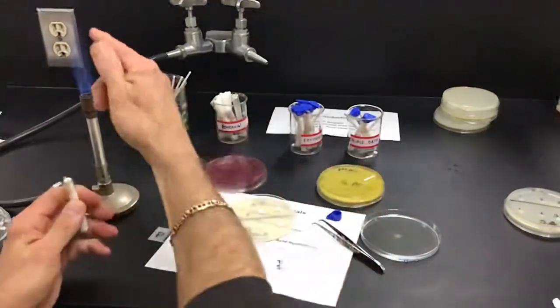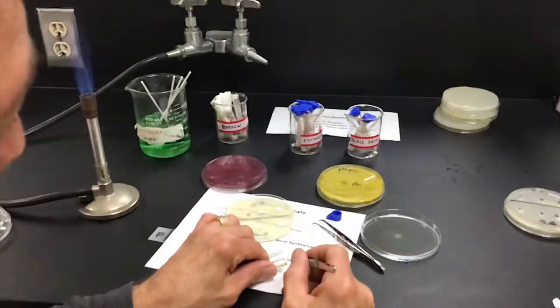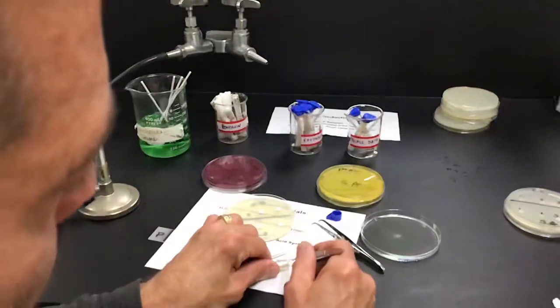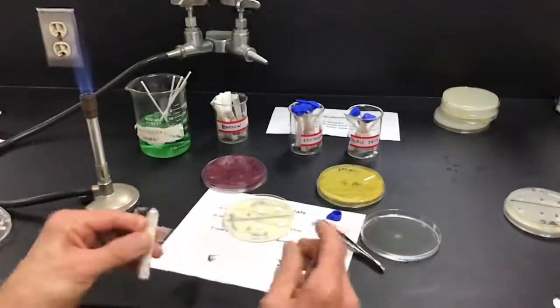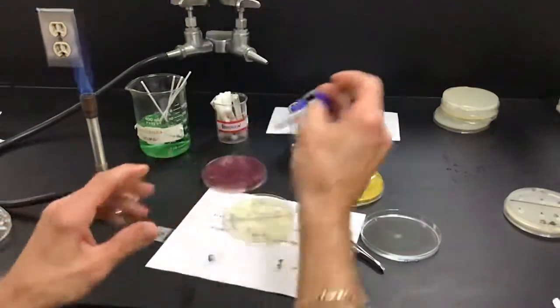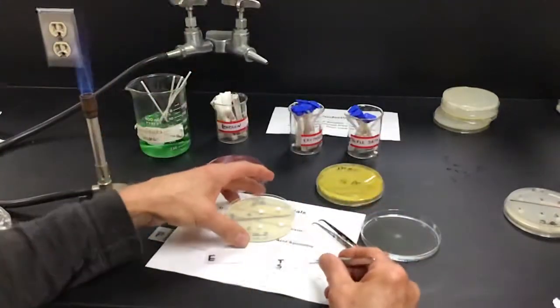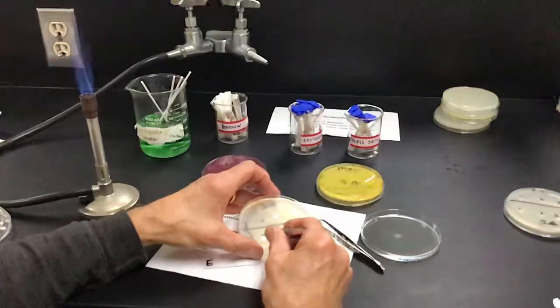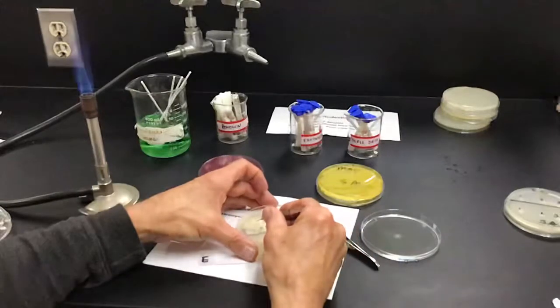Sulfa. Once again, this is our folic acid inhibitor. So unless they can find another pathway around the PABA, this should work. I told you guys before, bacteria are super smart, smarter than we are. They've been around a lot longer than we have. So a lot of things have figured out a way around this, but hopefully this E. coli and this Staph aureus have not. And we've got that in there.